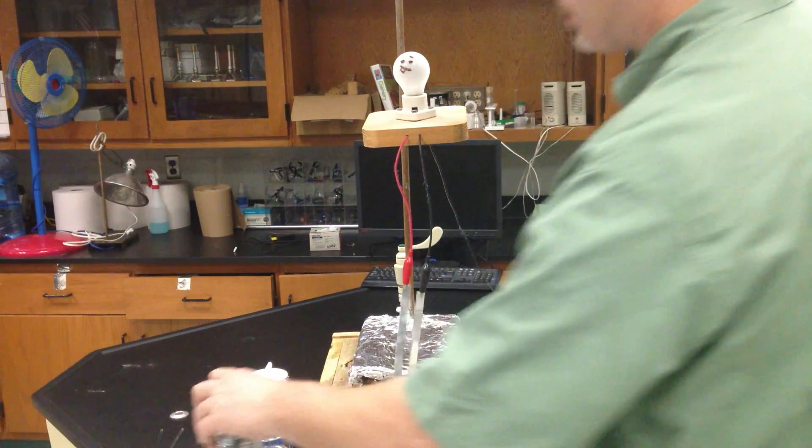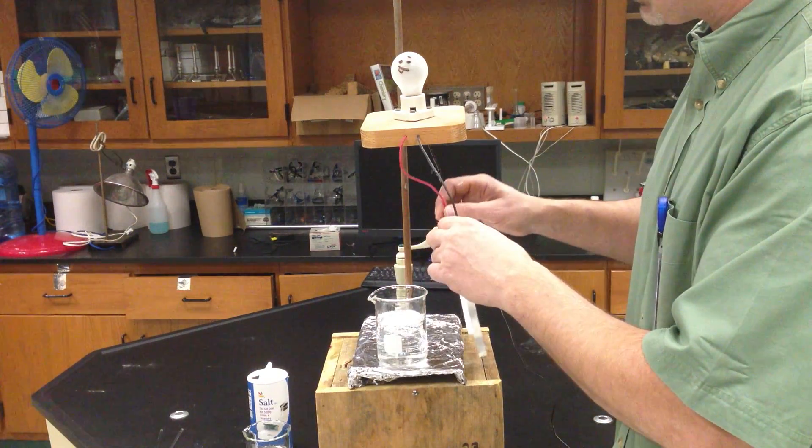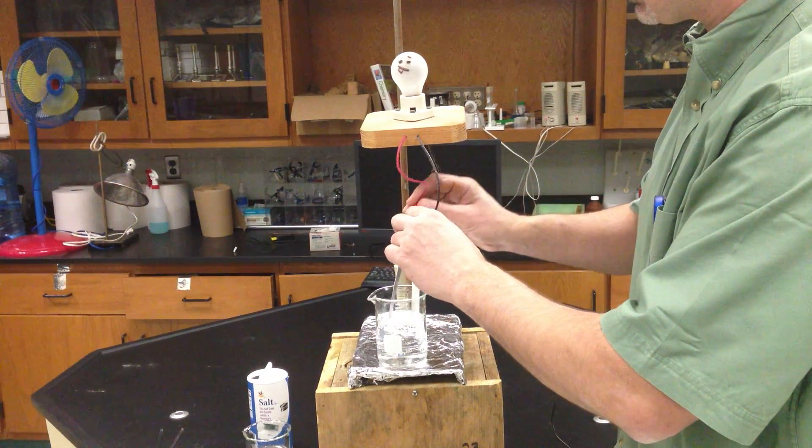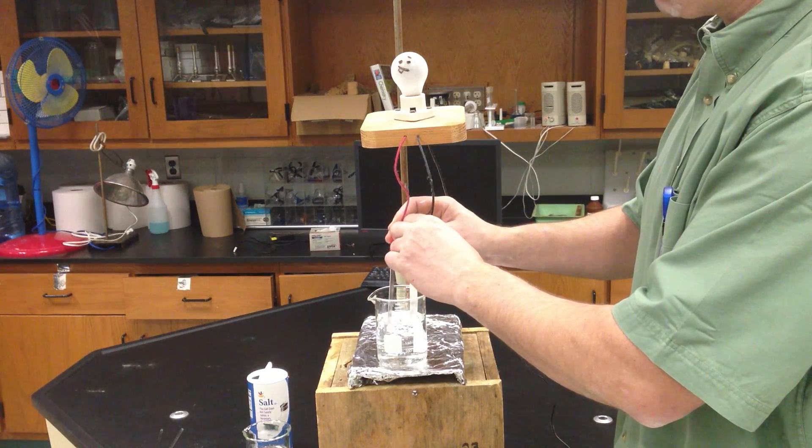I'm going to start with water, and water that is deionized. It doesn't have any ions in it. Water is not a very good conductor, as we can see. My little light bulb, Ernie, doesn't light up in pure water.